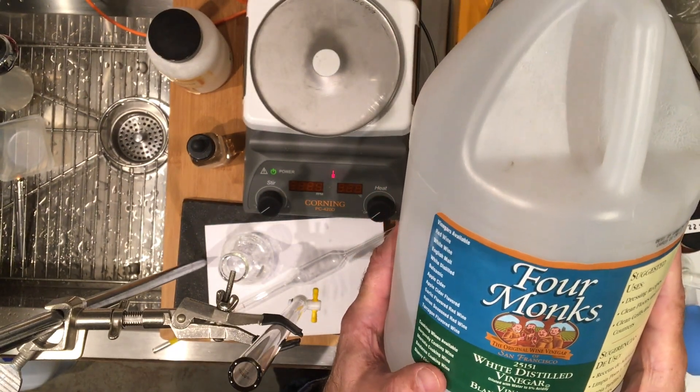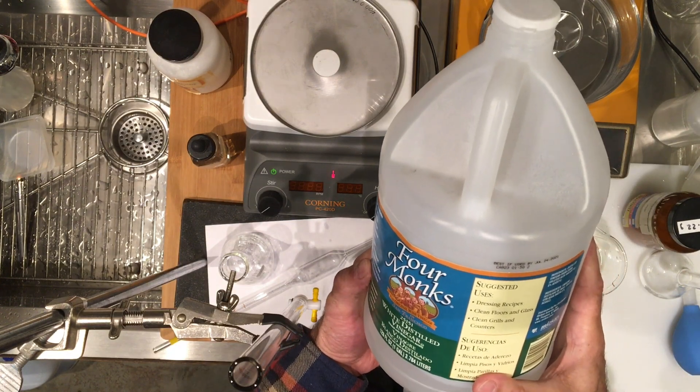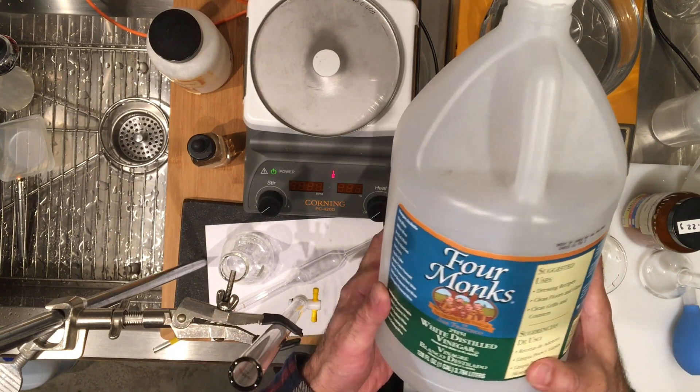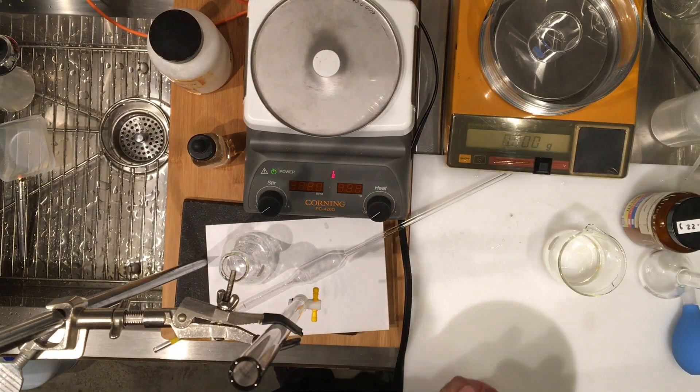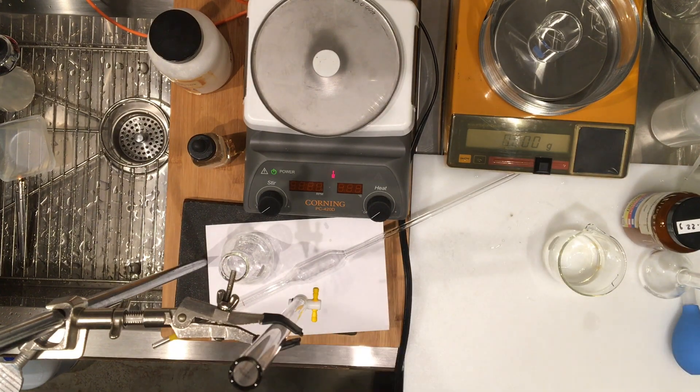But we're going to determine the concentration more exactly, and I've already poured in some of this vinegar in my beaker, and we're going to work with that.